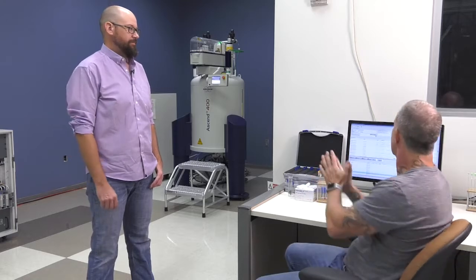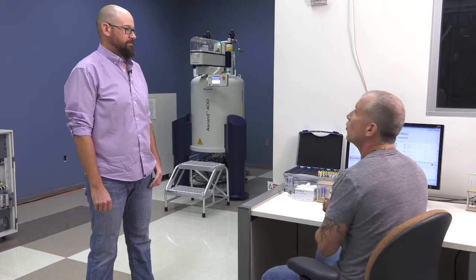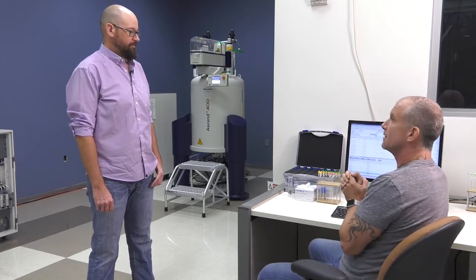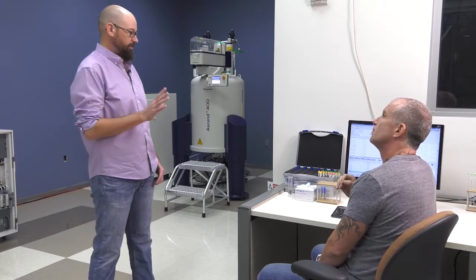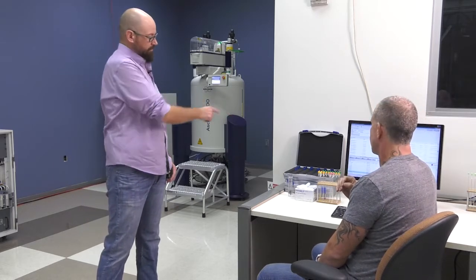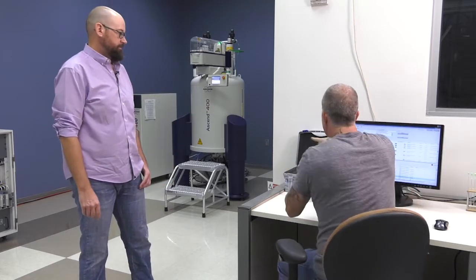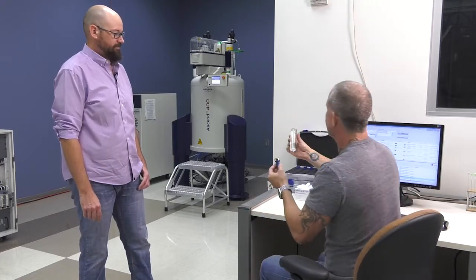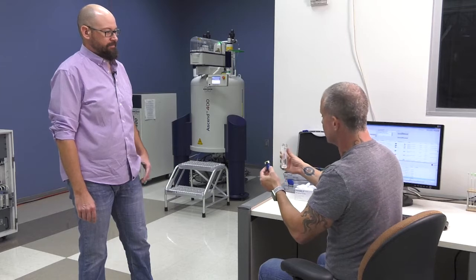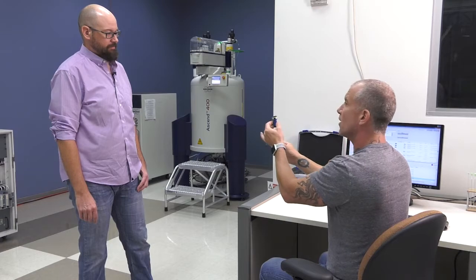And what I'd love for you to do is show me the process, now that I have it entered in Icon NMR, of what I need to do to get a sample ready to run on this automated system. Well, the first thing is assuming that you've already prepped your sample in an NMR tube and appropriate solvent. Then you would take one of the blue spinners here on the counter and place it into the sample depth gauge. So you usually have multiple of these because you can load up multiple samples? Correct. And this is meant to get the sample to the correct height, but it also shows you where the receiver coils are.